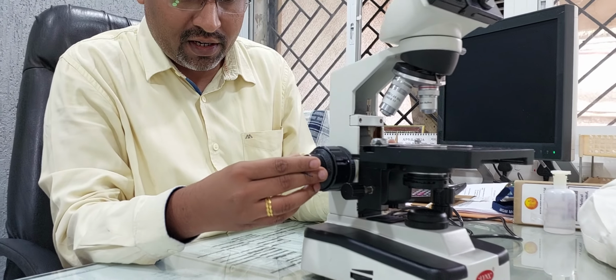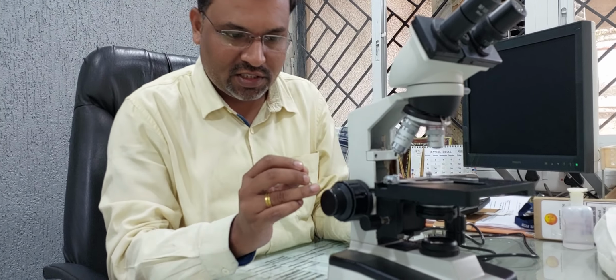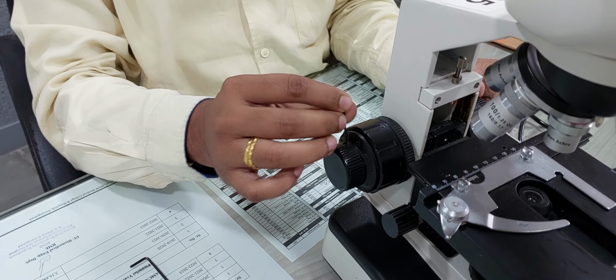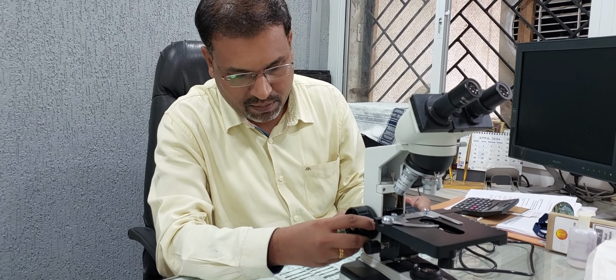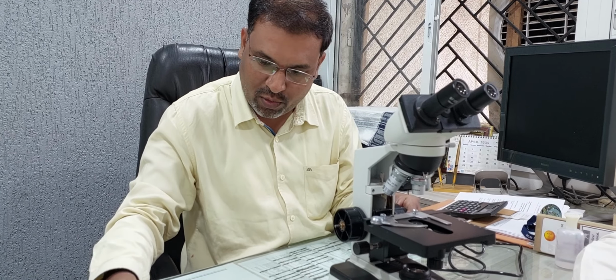there are Allen keys provided inside this knob. You have to take this type of Allen key, put it inside and try to open it. Rotate it properly, the Allen key comes out, and that means this cover will come out. After that, just rotate it and put this screw properly.